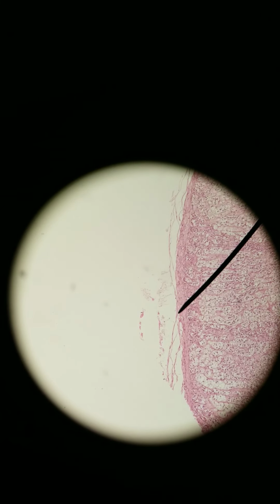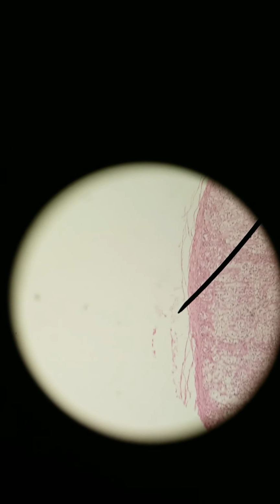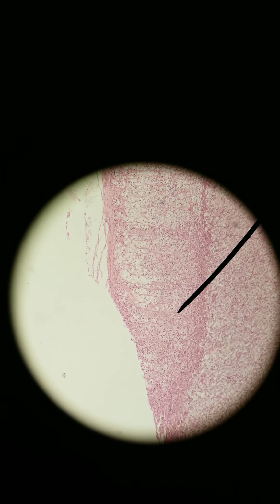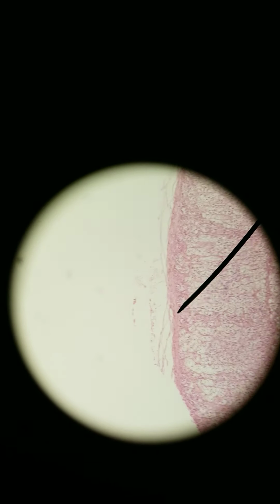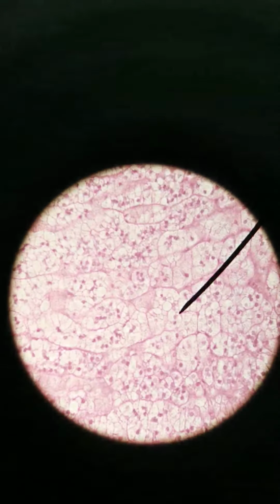Reticular fibers are a type of loose connective tissue. So this capsule is made of that as well. That's just the very, very outside. Where we have the actual cell layers that produce hormones, that's going to be ranging from this darker line through here to here. All right, let's see if 400x will help at all with this.